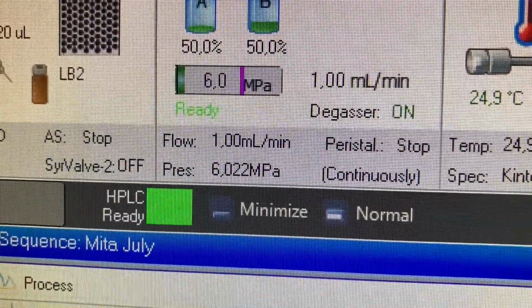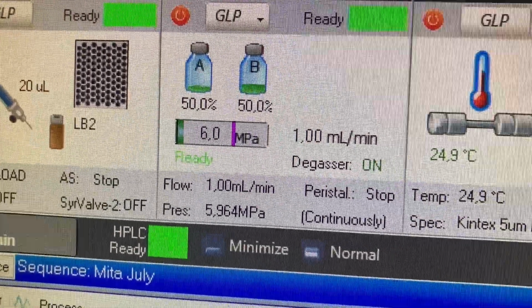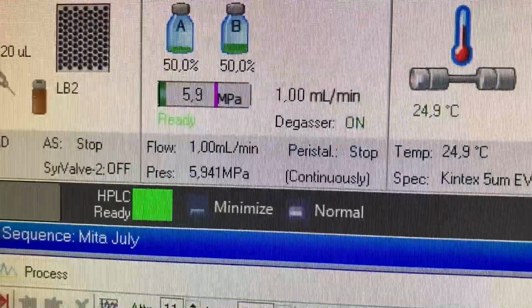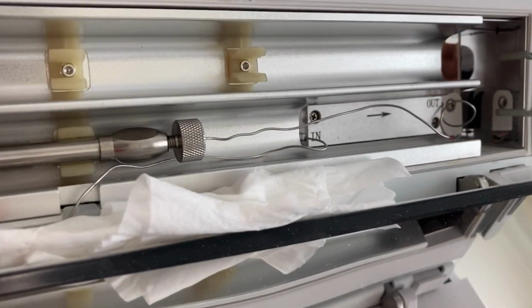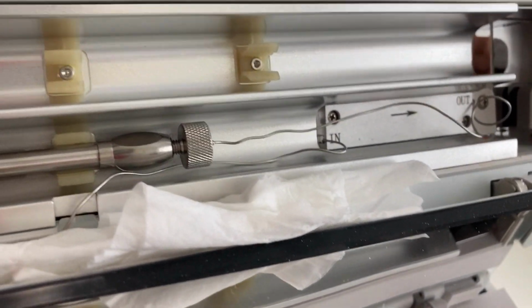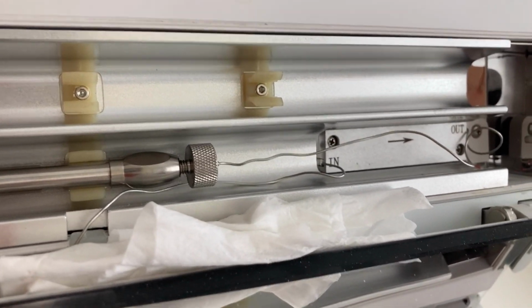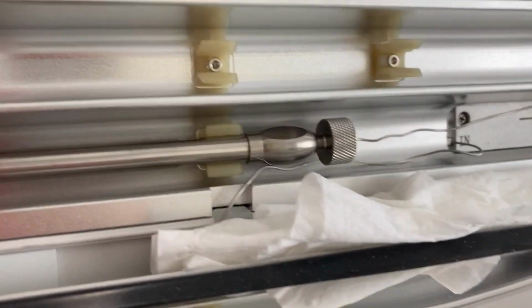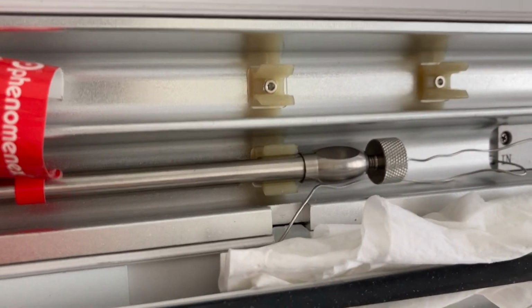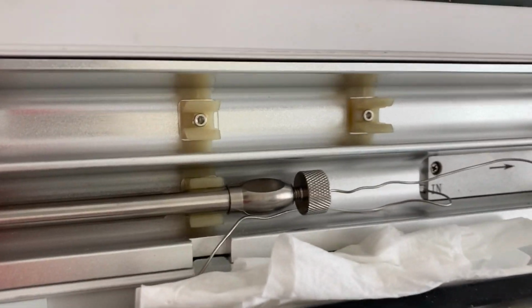So as you can see there, the pressure's building up, and at the same time as it's building up, I just keep an eye, especially in this area here, to see if it starts leaking or it just blows the ferrule out, in which case I've got to stop the pump and disconnect it, because I don't want to get air inside the column which can potentially bugger the silica lining inside it.